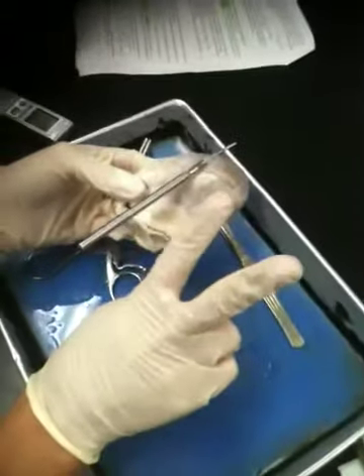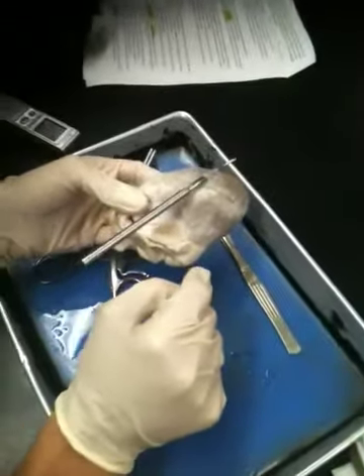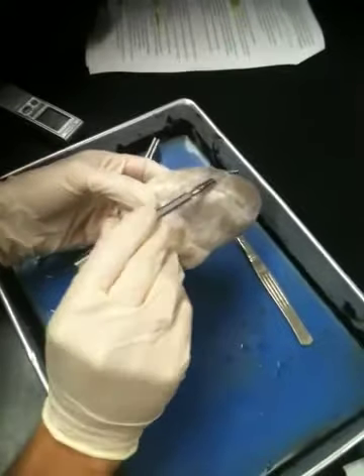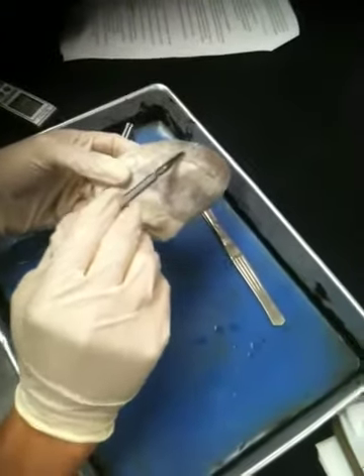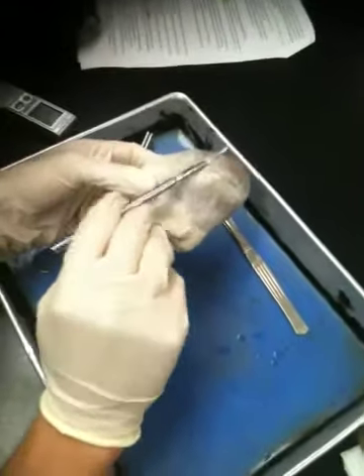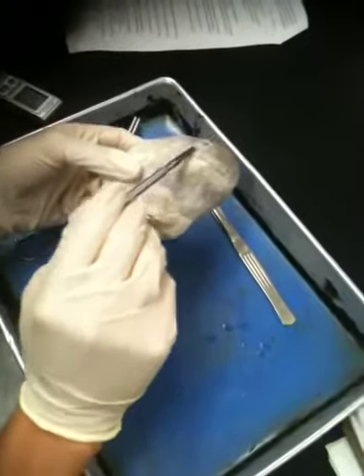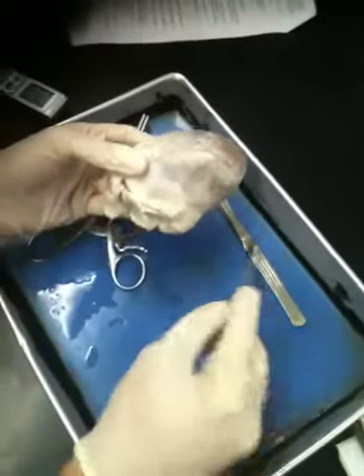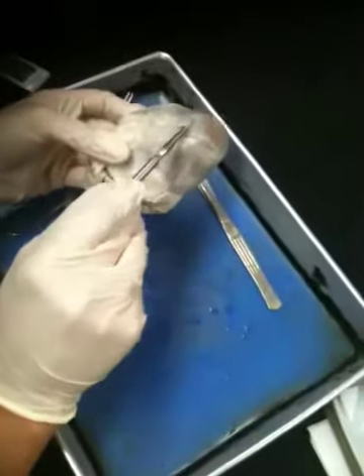You have two potential answers. One is epicardium. The other is what? Visceral pericardium. Okay. Remember, we don't just say pericardium because there's the fibrous layer, there's the parietal layer. So this membrane on the outside of the heart is specifically either epicardium or visceral pericardium. And that's the thin membrane clinging to the outer surface of the heart.